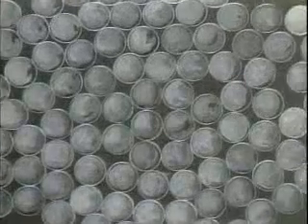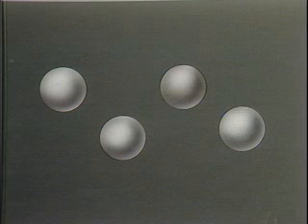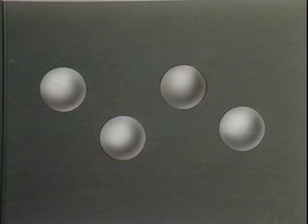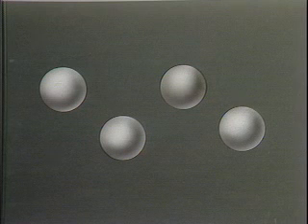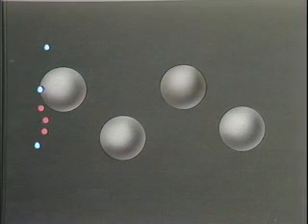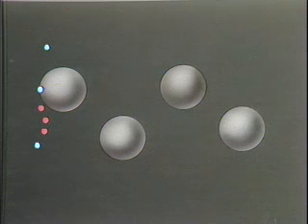Animating the separation processes that occur because of differences in adsorption may aid in understanding how the separation of the mixture occurs within the column. If we assume these large beige circles represent the stationary phase packed into the column, it can be seen that there is still a lot of space through which the vapor can move. When the vaporized mixture, represented here as red and blue dots, enters the column, some of the molecules are adsorbed into the stationary phase, while others are carried along through the column.